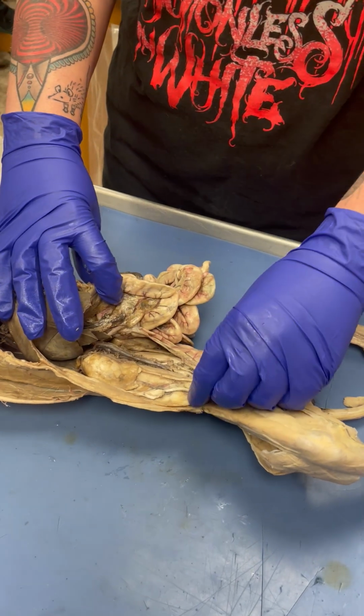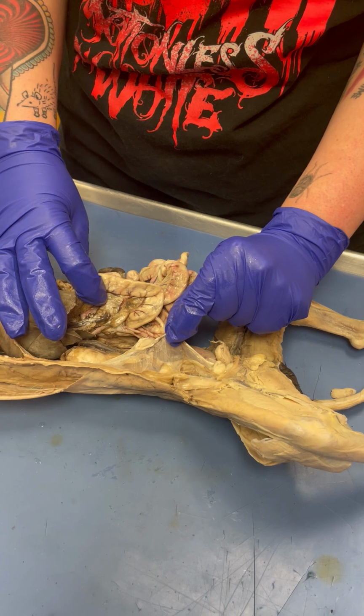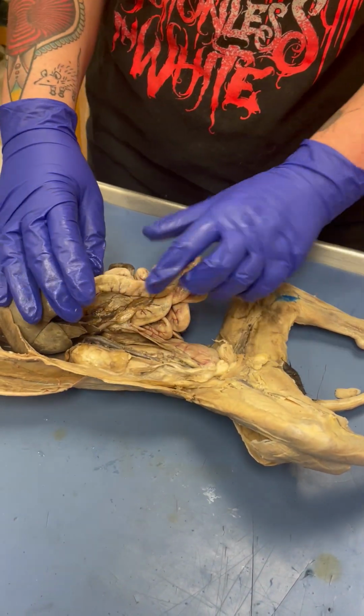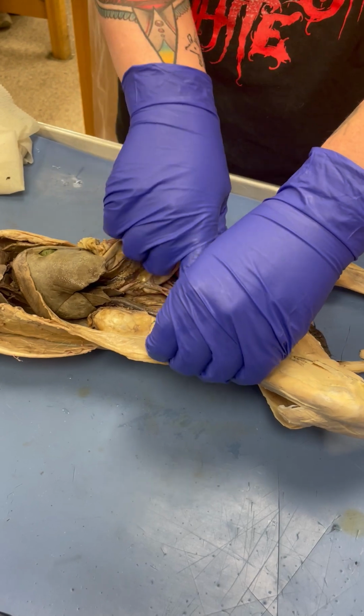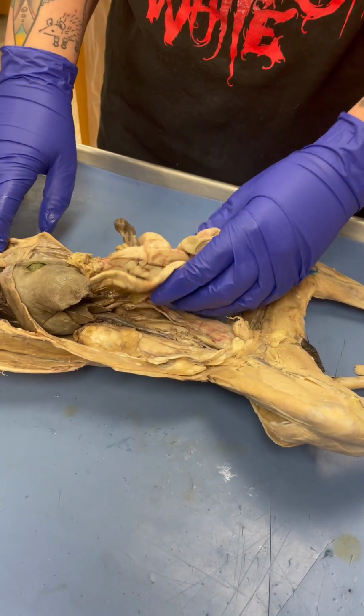Kidneys. This is this right here. The ovary. Oh, that's the ovaries, uterus. That's the uterus. This is, that's the ovary. I was trying to see if it was attached. It kind of is attached more to the side. Yeah, it's like pulled more out to the side of the body. See how it's sealed to the side of the body rather than the back. Good to know.